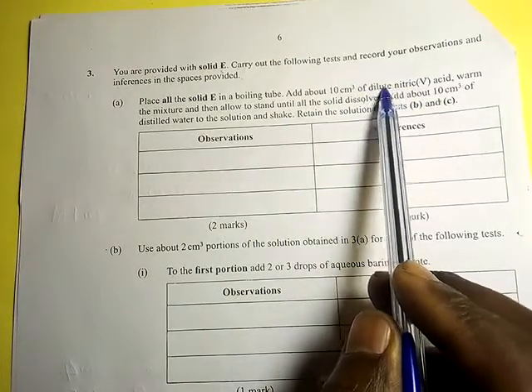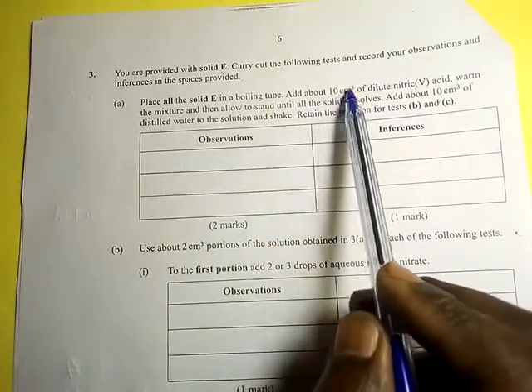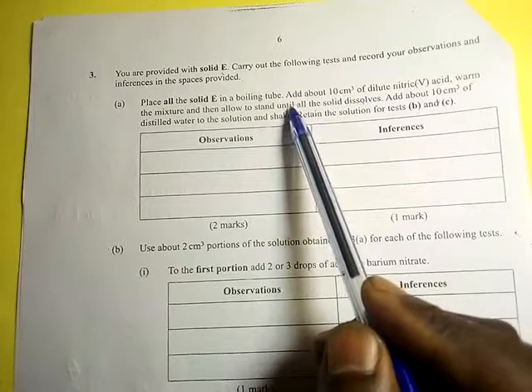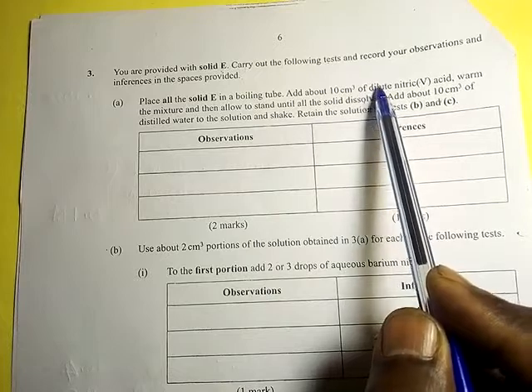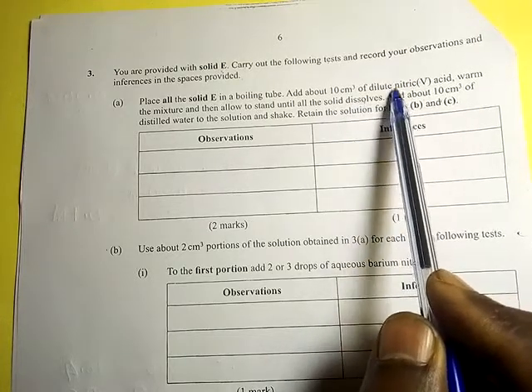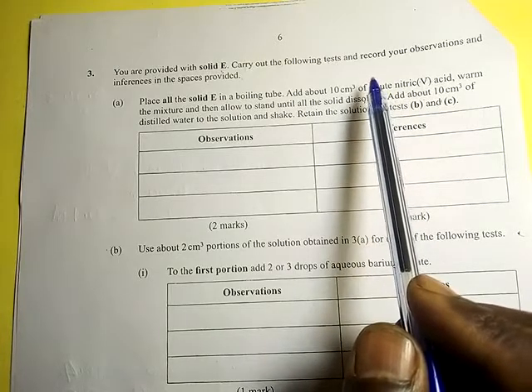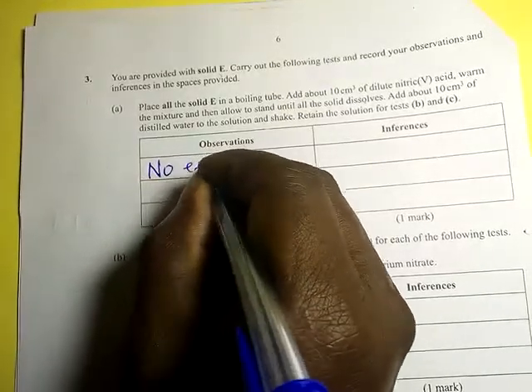We are adding dilute nitric acid to salt E, which we don't know. The salt could be something like a carbonate, so we expect to see effervescence because we are adding an acid. Whenever you are adding an acid to a given solid, just expect effervescence. If there is no effervescence, it means there is no carbonate or sulfite inside. For this one, the observation was that there is no effervescence.